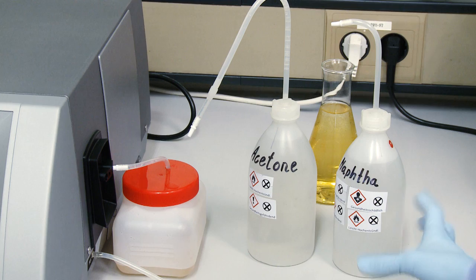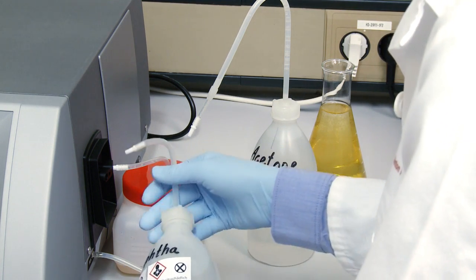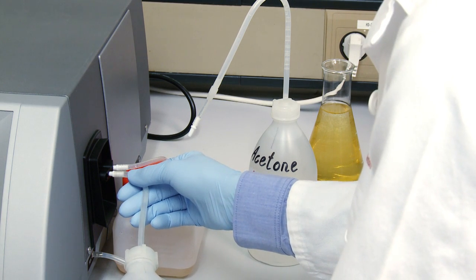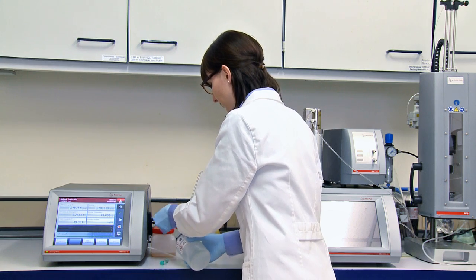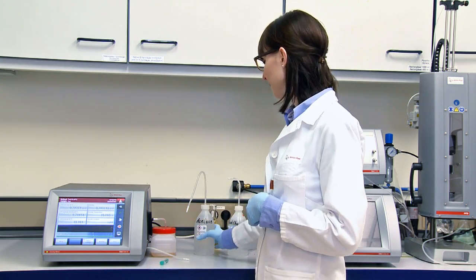Cleaning is just as easy as the filling procedure. A proper solvent for fuel is naphtha. And then, as a final step, acetone.